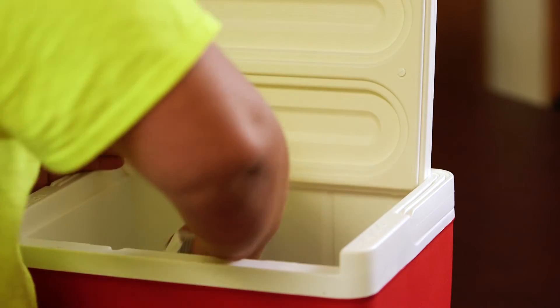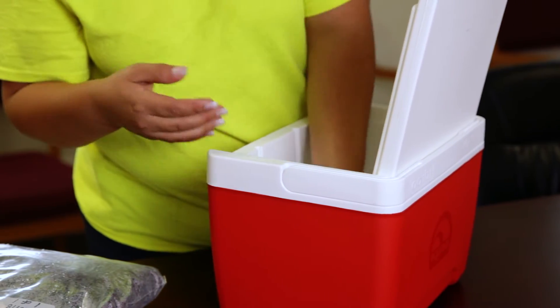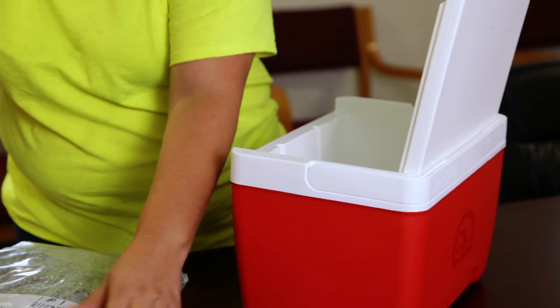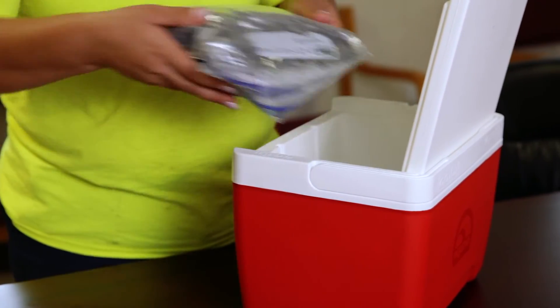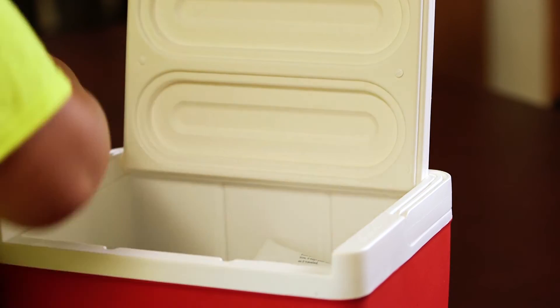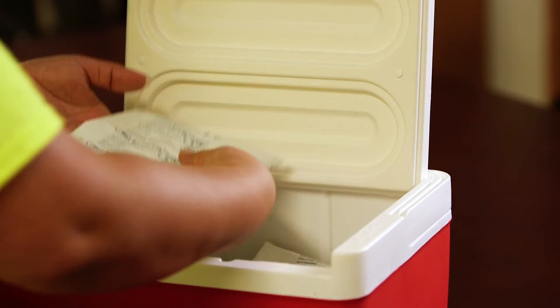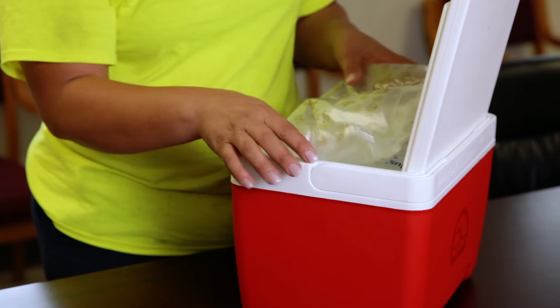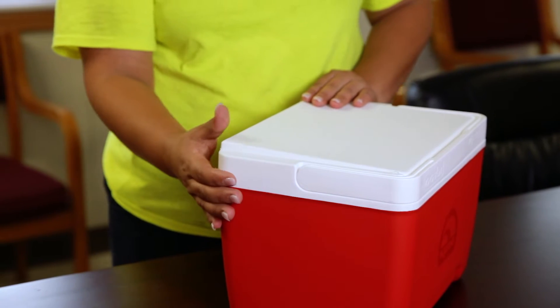Immediately following, place a layer of gel ice packs at the bottom of the cooler, then place the sample on top, followed by another layer of gel ice packs. Ship overnight to the lab you have chosen to run the analysis. A refrigerator can be used to cool and store the sample prior to shipping, provided that the sample is not cooled to below freezing during storage.